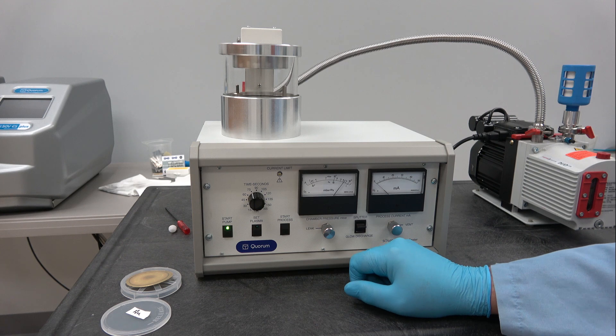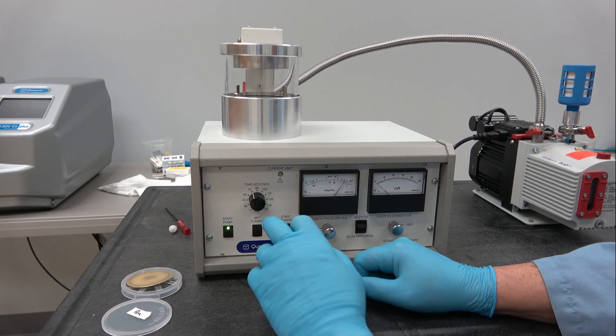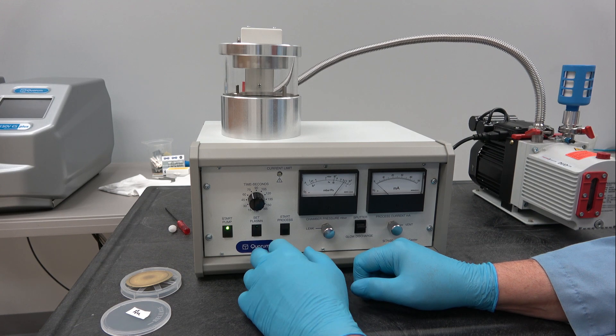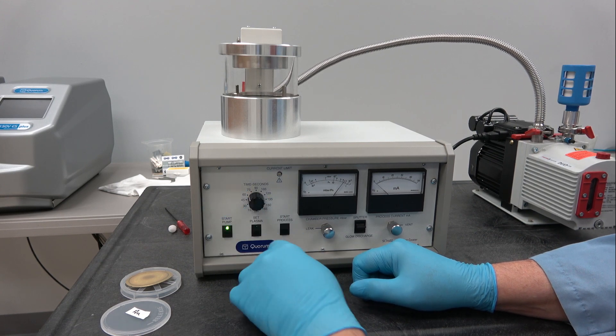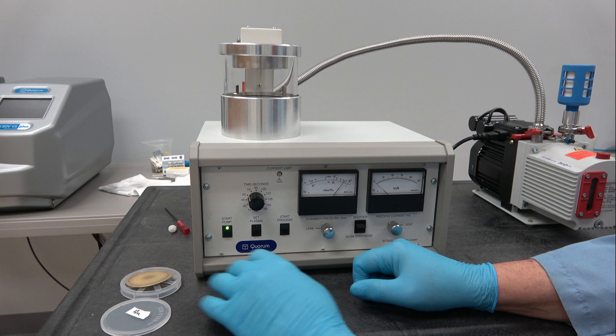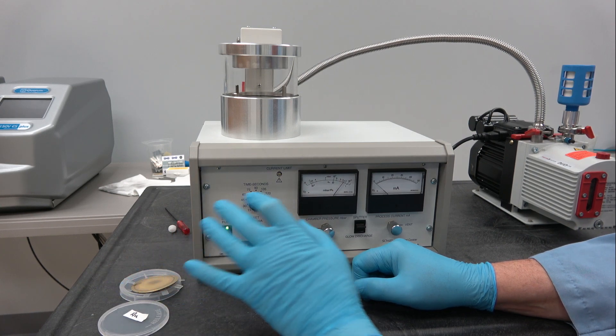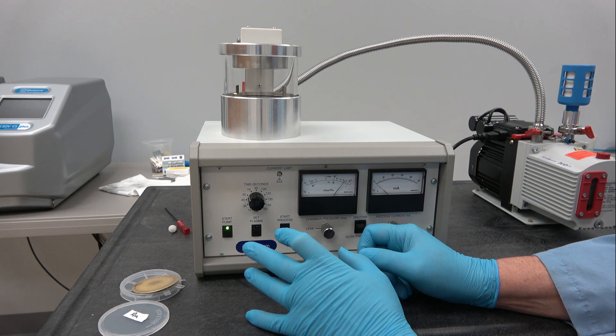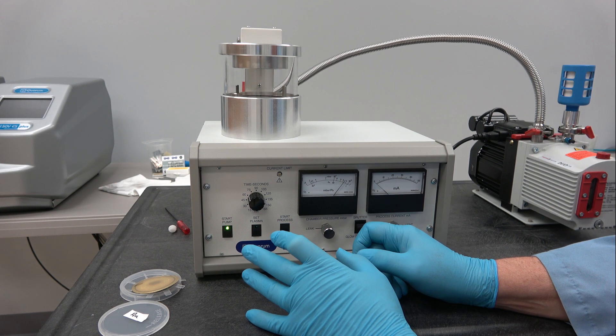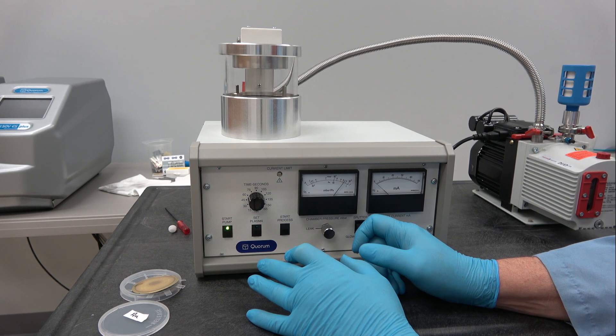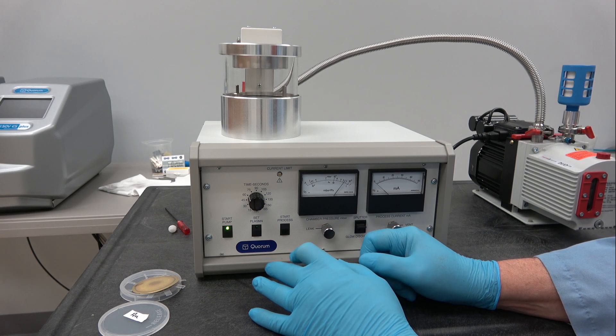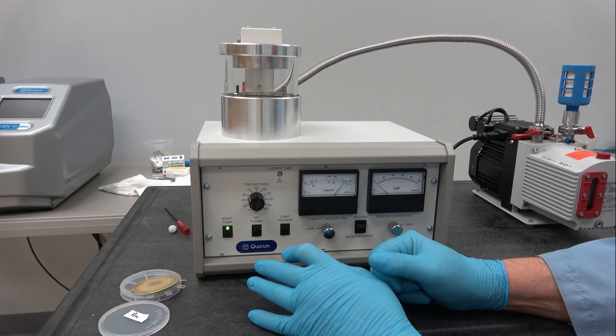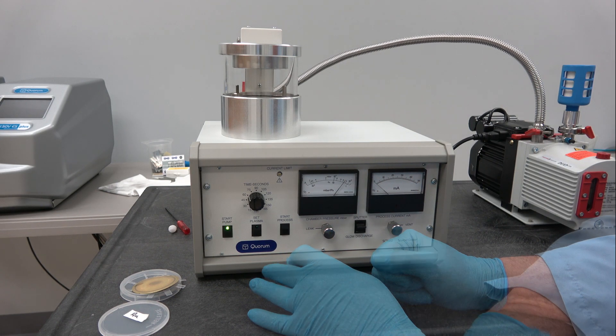So the next step we're going to do is we're going to set plasma. And I removed the target because as I explained, I don't want to sputter in this chamber. This is sort of a show unit, display unit, not an actual working unit here in the laboratory on a daily basis. We use much more sophisticated systems.